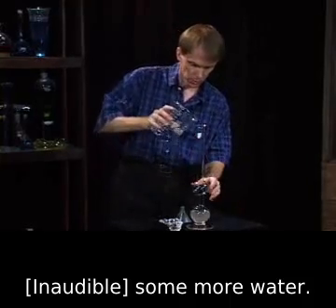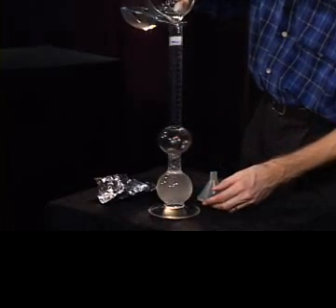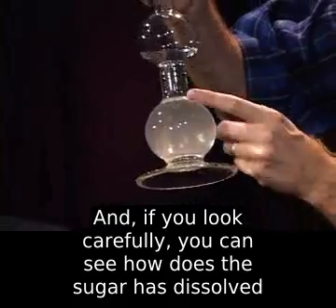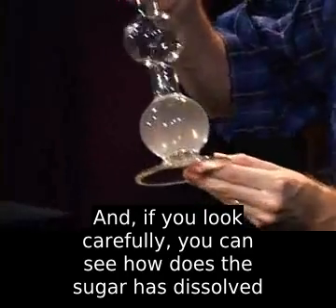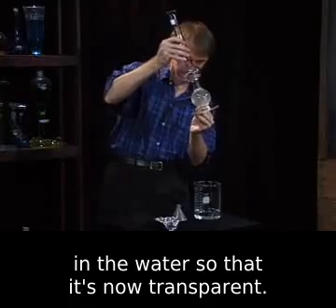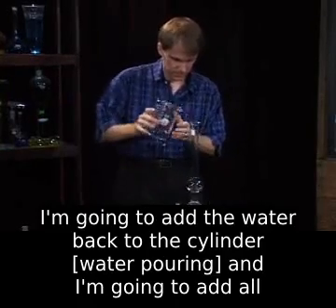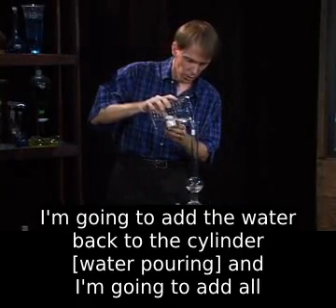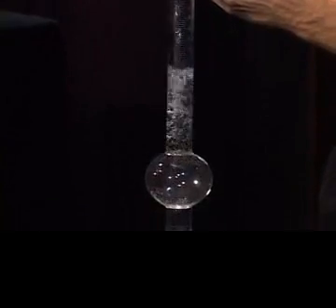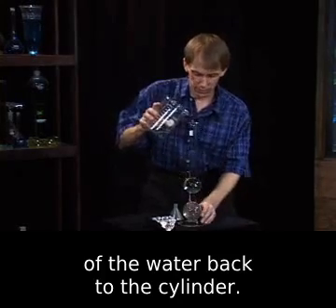Okay, let's add some more water. And if you look carefully, you can see how the sugar has dissolved in the water so that it's now transparent. I'm going to add the water back to the cylinder. And I'm going to add all the water back to the cylinder.